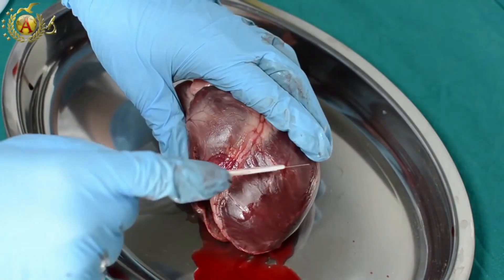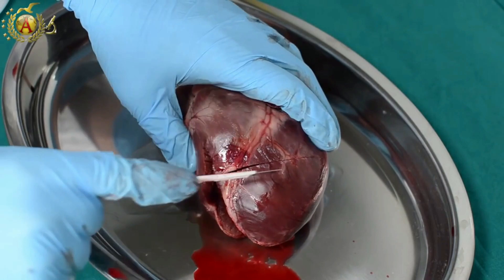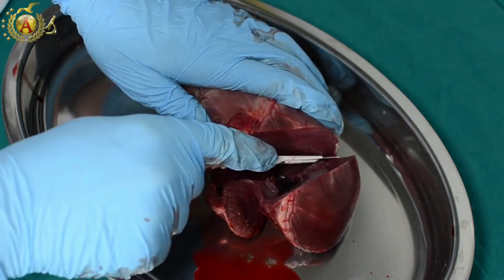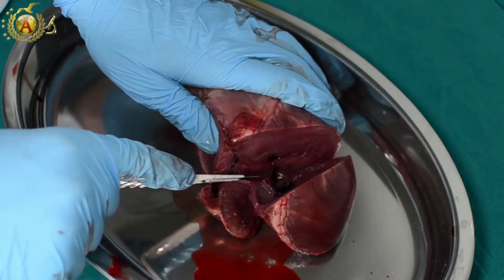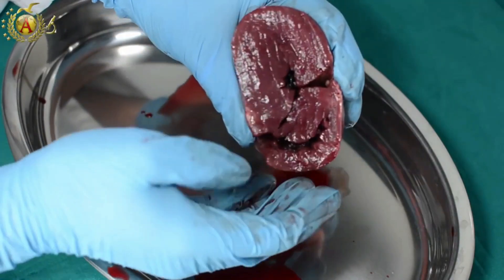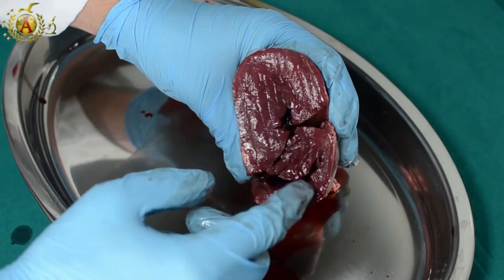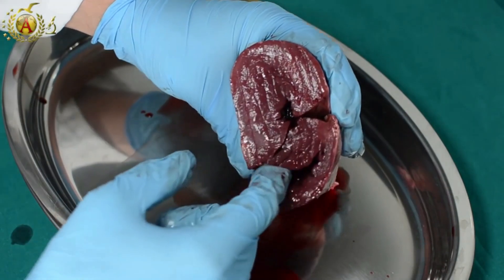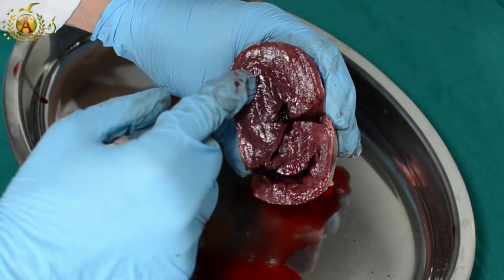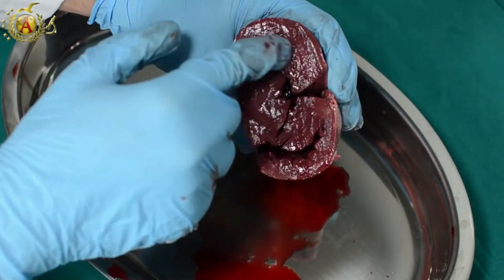The last thing that we'll observe in this autopsy is the different thickness between the ventricle walls, making a transverse cut of the ventricles. You can see how the right ventricle has a larger cavity but a rather thin wall, and how the thickness of the wall of the left ventricle is extremely large compared to the right one.